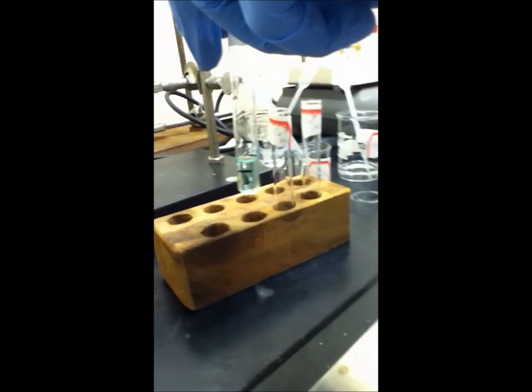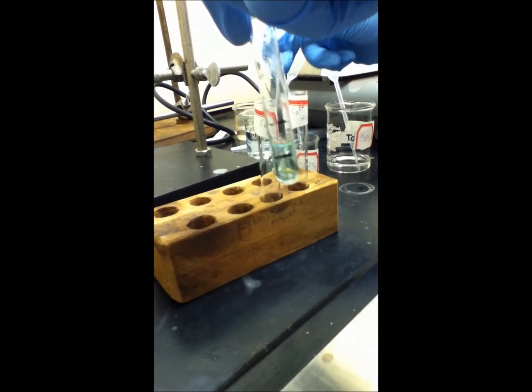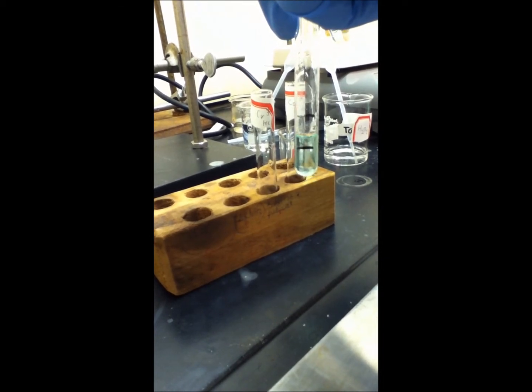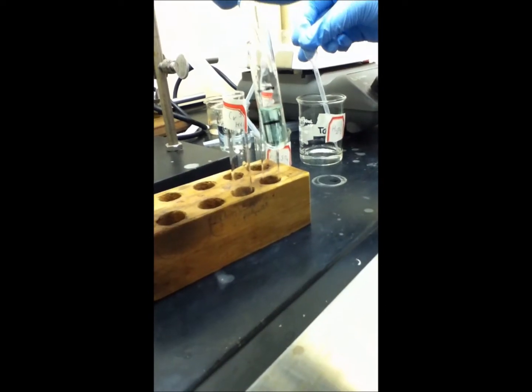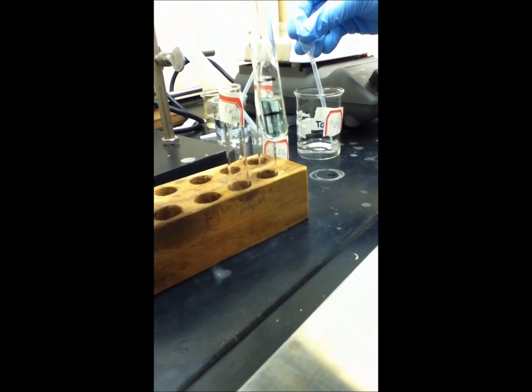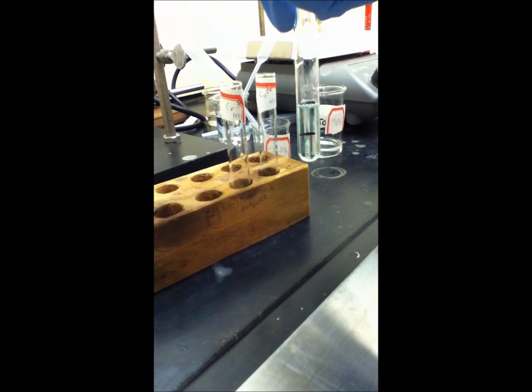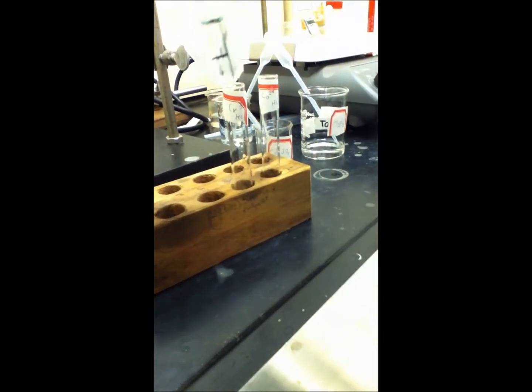We have three test tubes. The first one contains nickel. We're going to add five drops of sulfuric acid, then add one milliliter of 30% hydrogen peroxide. No changes occurred.